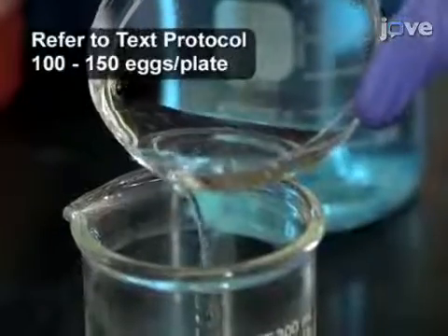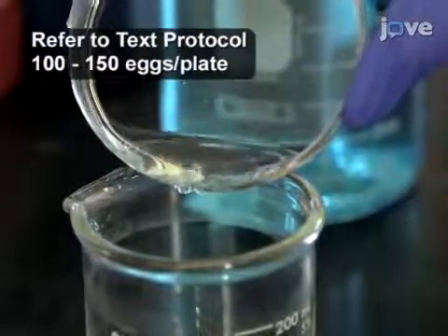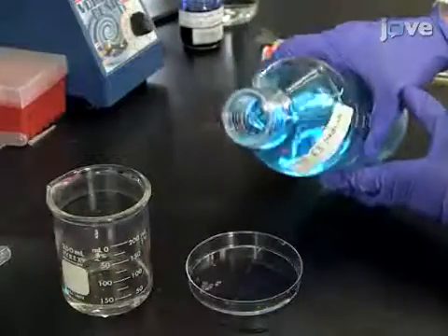After setting up zebrafish crossings and collecting eggs, allow the eggs to settle to the bottom of the dish and pour off the water. Use a fine-tip disposable transfer pipette to remove any remaining water, then add back the E3 medium.